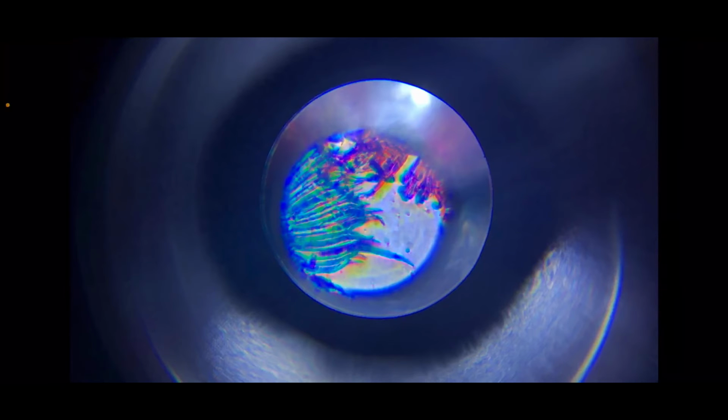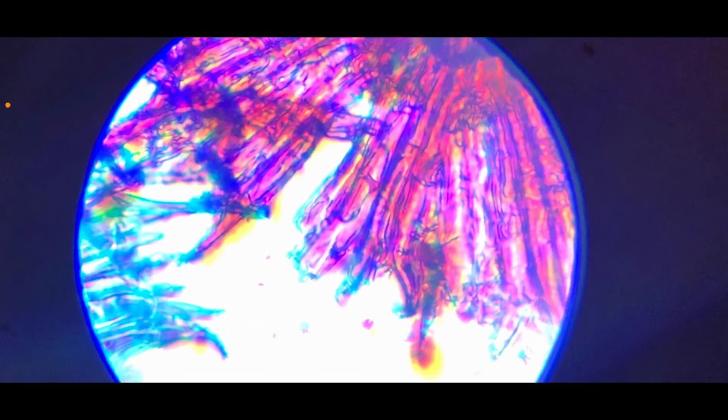And now let's look at the last magnification, which is 60. This is only 30. I wonder what 60 will bring us. Just look at this. What do you think about it? Isn't this just so cool? Like in the macro world, which is the world that we live in, you can see almost nothing as beautiful as this. Maybe this is because we're so used to all the marvelous things in our world that we become used to it and not feel excited towards it anymore.